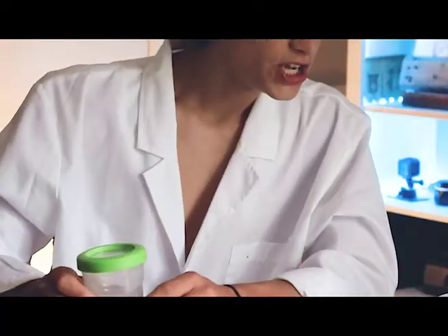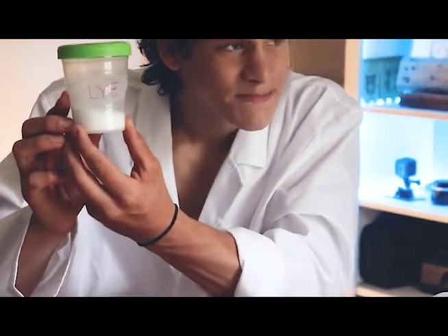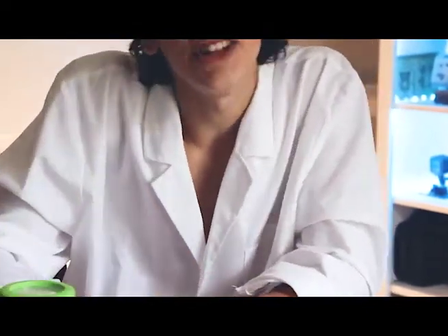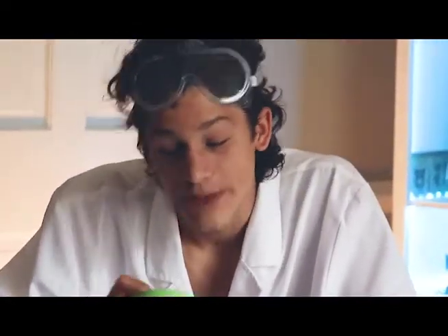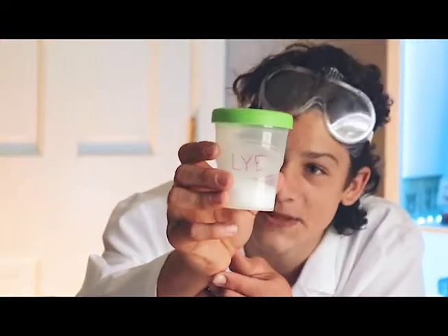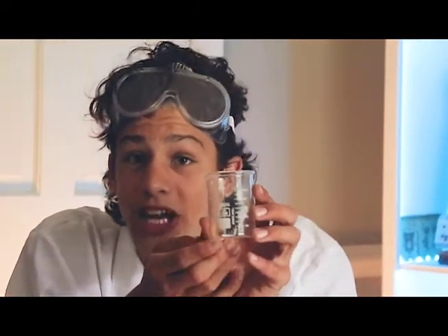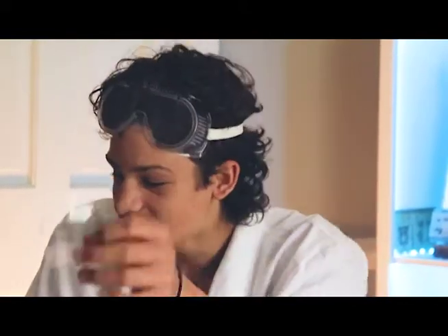To get started, you're going to need a couple of supplies. First, you're going to need some lye. Now, this is a very, very deadly substance, and unfortunately it looks a lot like both table salt and sugar. That's why you always want to mark your deadly substances — this one is marked in beautiful pink marker. Next, you'll need a 100 milliliter beaker, a 250 milliliter beaker, and a little glass disc called a watch glass.